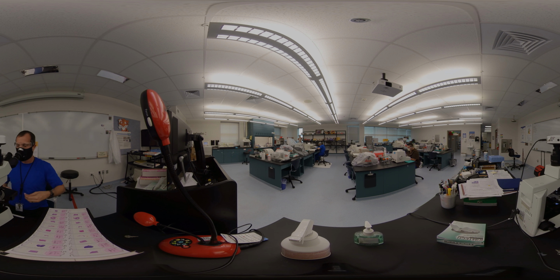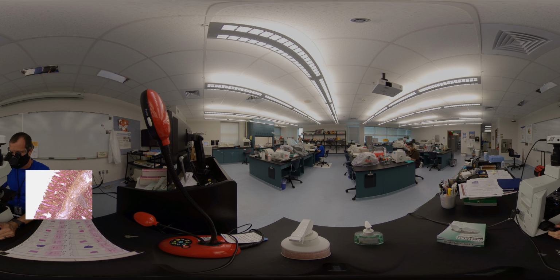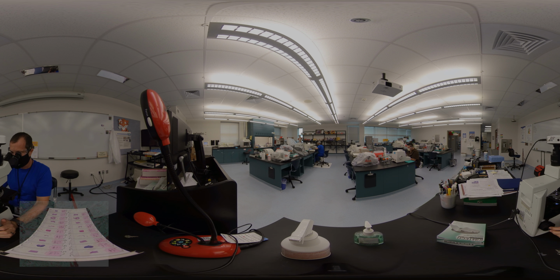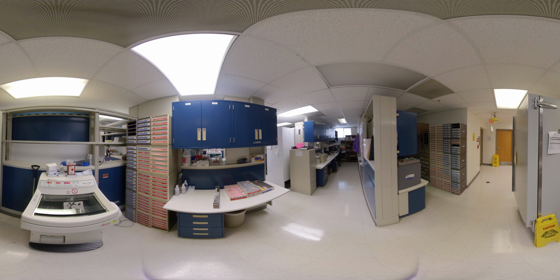During the review, the pathologist will take the information that was generated during grossing and the information on the slide and write a report based on his findings. Those findings are placed in the medical system's records for the patient's follow-up medical care. As stated in our previous lesson, once the pathologist is done with the slides, the blocks and slides will be stored in an archive for at least 10 years. This ends another lesson for the introduction of clinical histology.